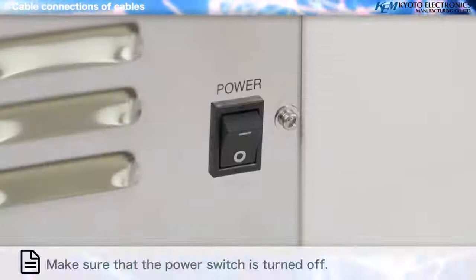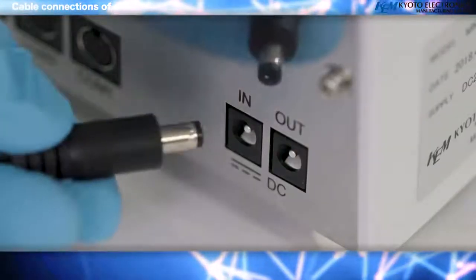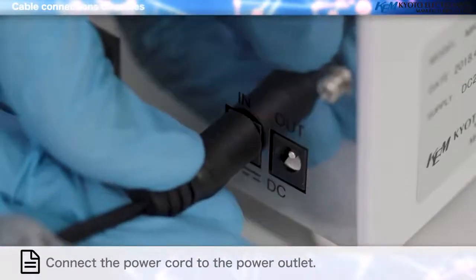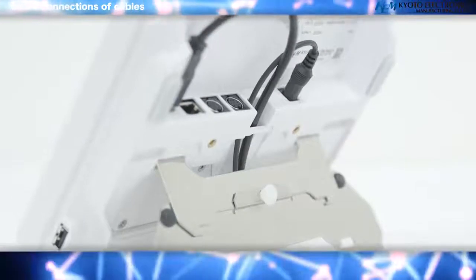Cable connections. Make sure that the power switch is turned off. Attach the power cord to the AC adapter and connect the connector plug of the AC adapter to the power connector on the back of the main unit.